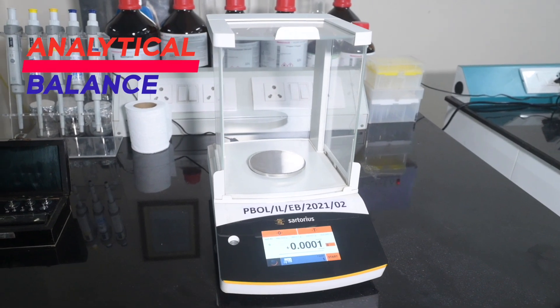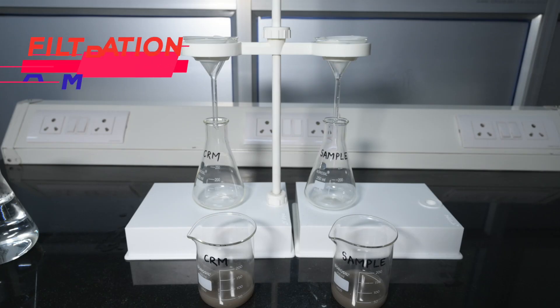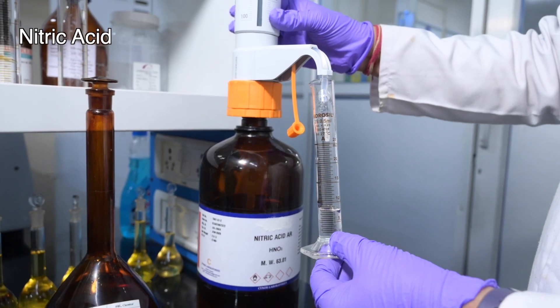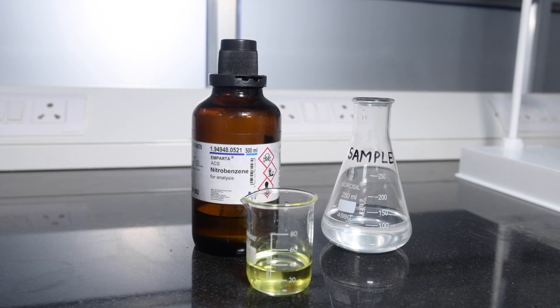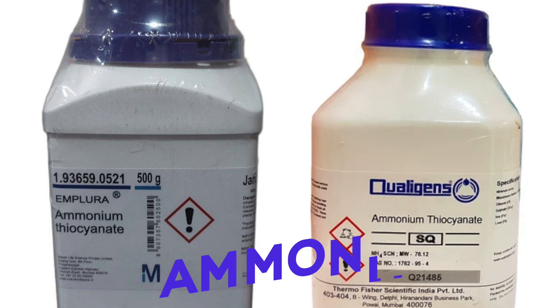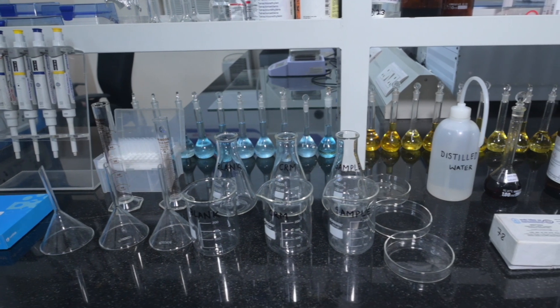Equipment and consumables required for sample testing includes: analytical balance, oven, desiccator, hot plate, filtration assembly, titration assembly, and various glassware and reagents — distilled water, nitric acid, Whatman filter paper number 40, nitrobenzene, silver nitrate 0.0025 normality, ferric alum indicator, and ammonium thiocyanate 0.0025 normality.